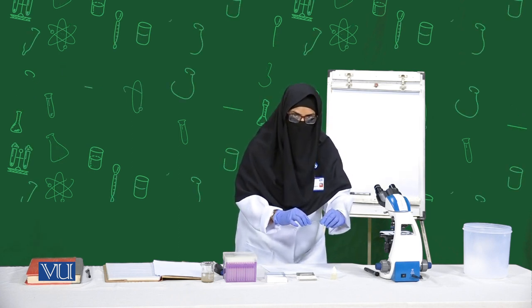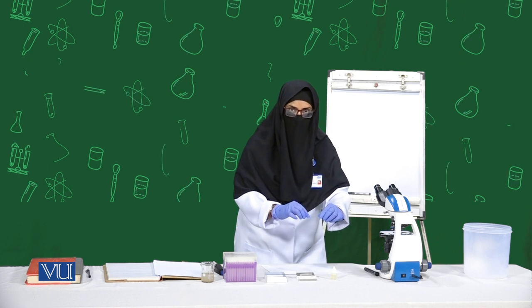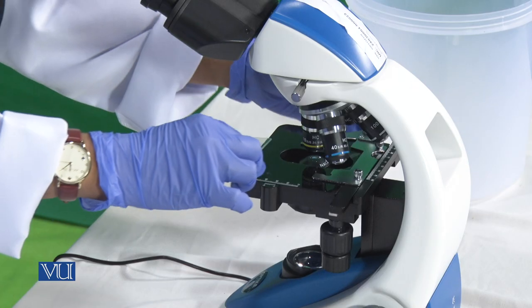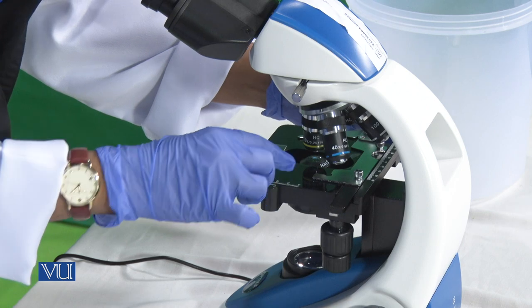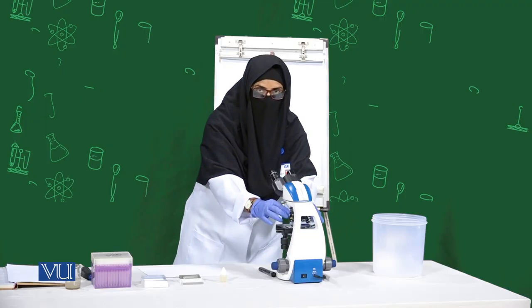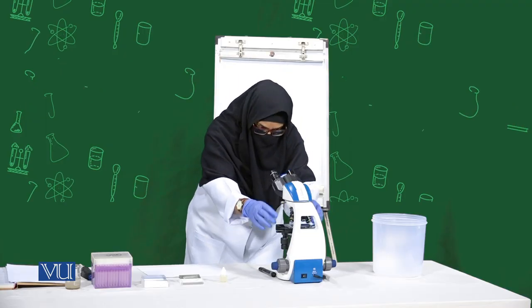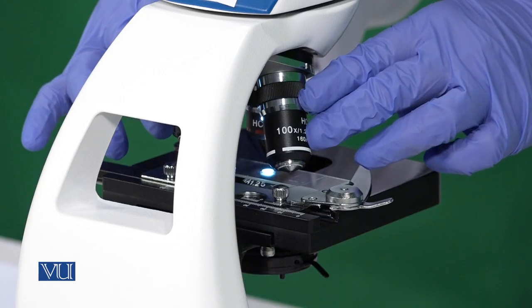First we will set our slide and we'll see under the magnification power of 4x.